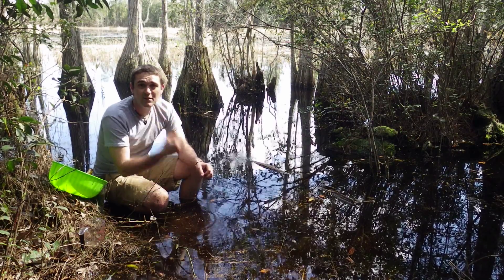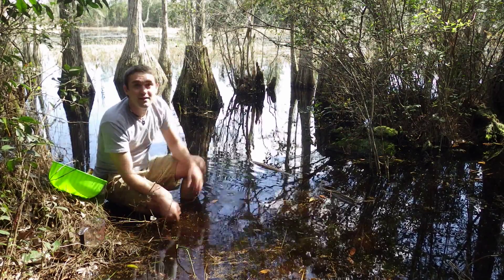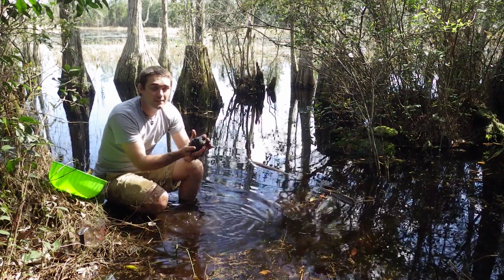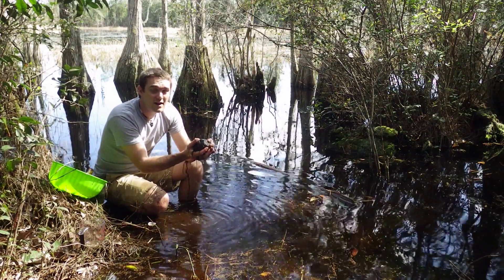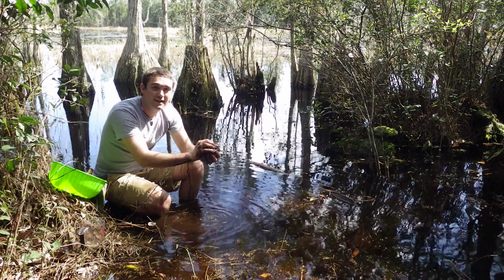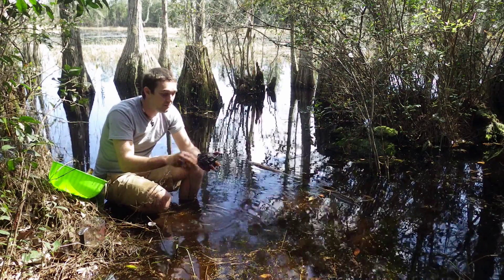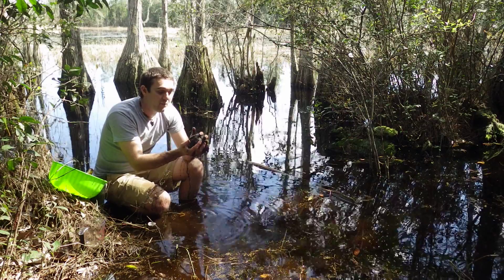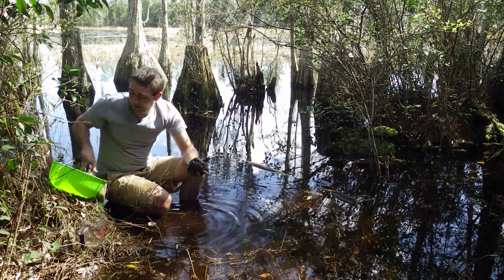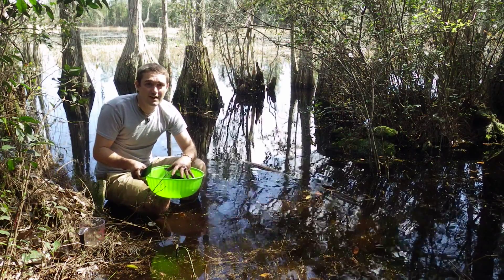There are a lot of source materials you need in order to build this column, two of which we're going to collect in this environment. The first and most important is the source mud. In this ball of mud you notice it is extremely wet, with very few rocks. I'm going to pick out as much organic material as possible so I have more of a squishy, snowball-like texture, then fill up the bowl with enough mud to build four Winogradsky columns.